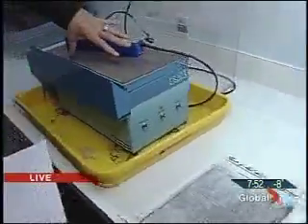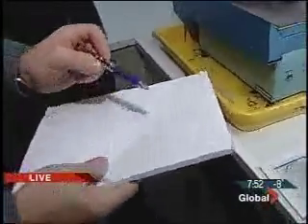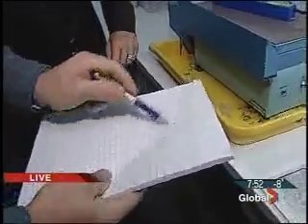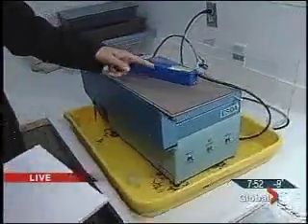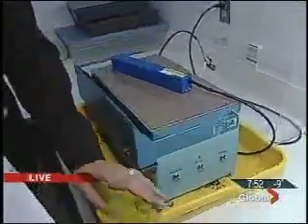It'll bring up indentations in a non-destructive manner. Everybody's probably familiar with the late-night detective movies where you've got something on the pad of paper and then you scribble over it to bring up the indentations. Well, that's what this system does, only it does it using a non-destructive electrostatic field.